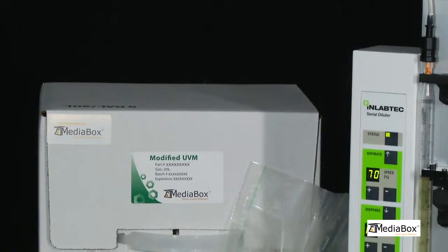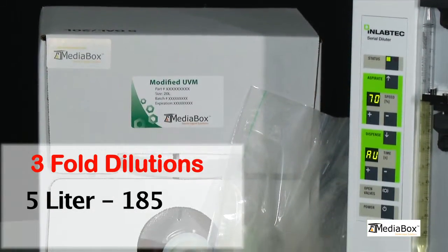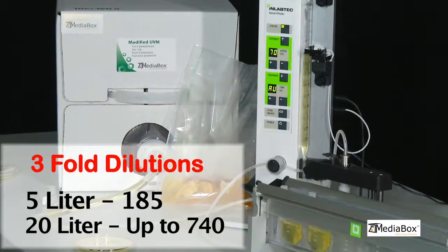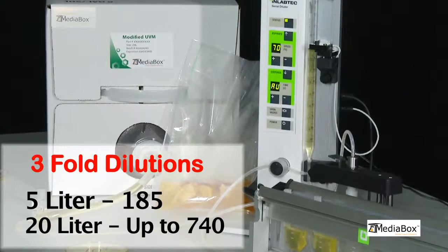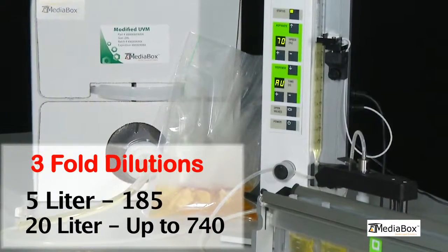With the InLabTech diluter, 185 three-fold dilutions can be made with a 5-liter media box. Up to 740 three-fold dilutions can be made with a 20-liter media box without having to change the buffer solution.